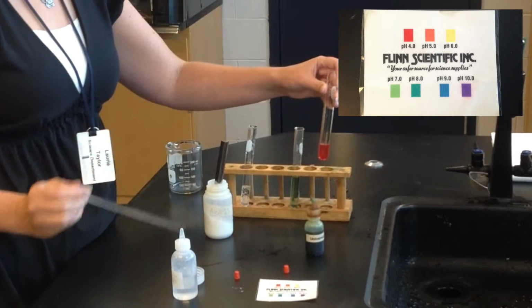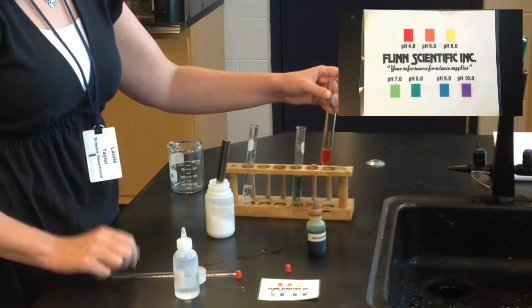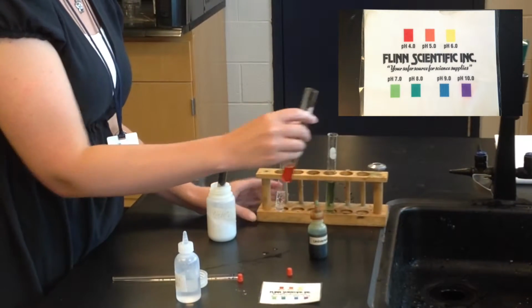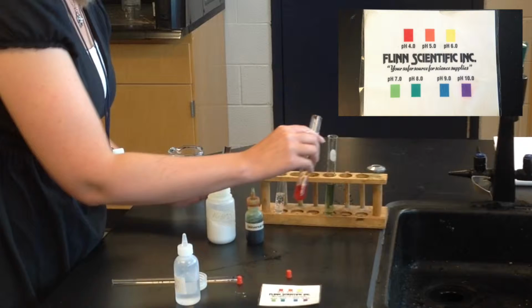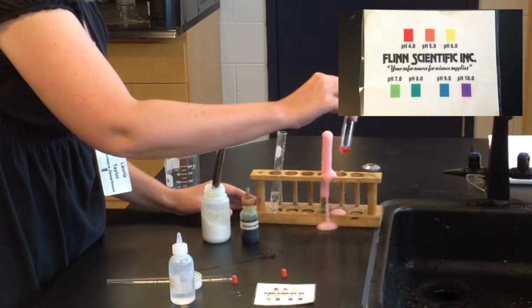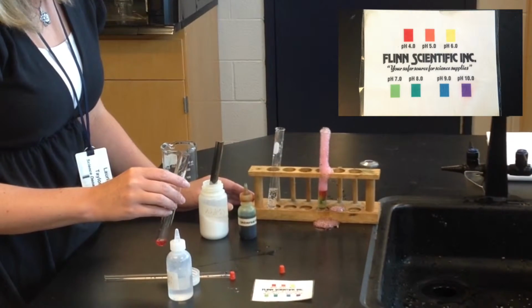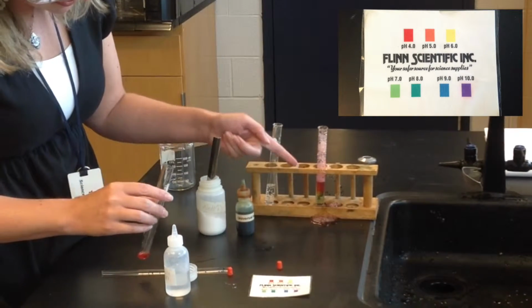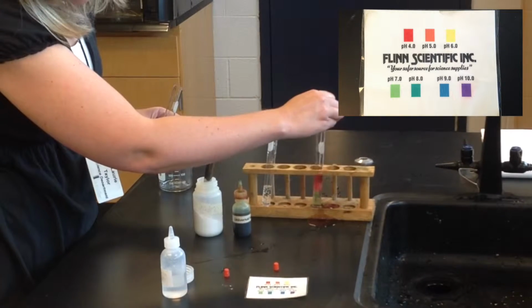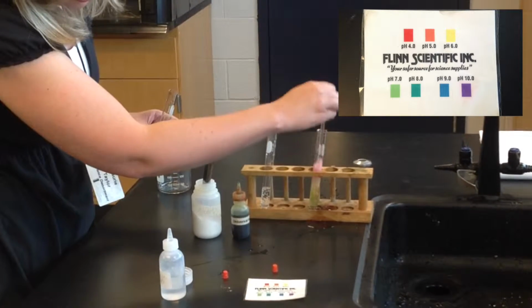Okay. So what happens when an acid and a base mix? You should get a neutralization reaction. Let's see. Just where you can see it. Just add this in. So we should see the nice bubbling occurring again. And a definite color change. You see lots of stuff going on here. Lots of different colors. And we'll need to mix them up.